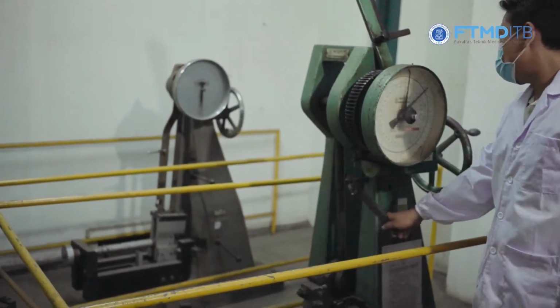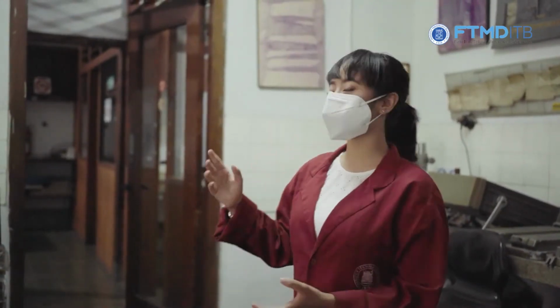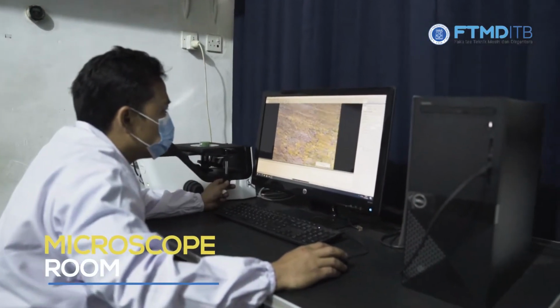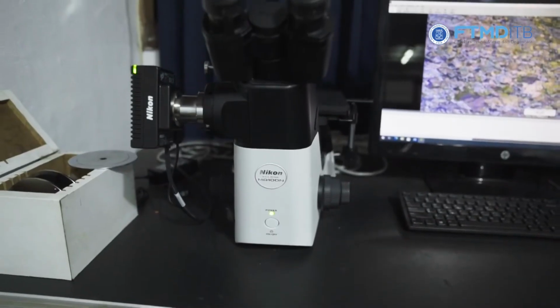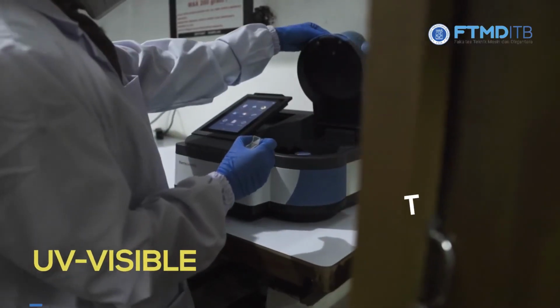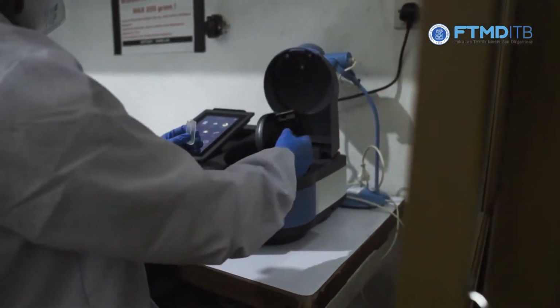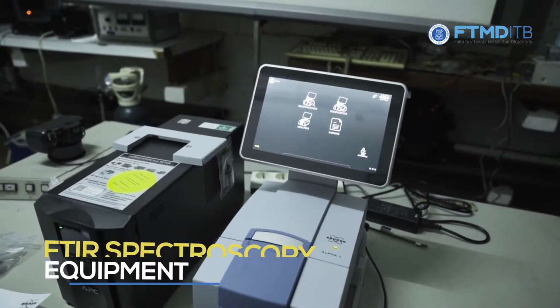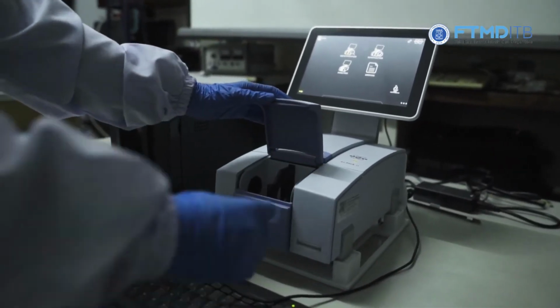Let's move on to the other room. Besides mechanical properties characterization, we have several pieces of equipment for visual, optical, and chemical characterization of materials. Visually, we can see the structure of materials in metallography through microscopes that we have in this room. This is our UV-visible spectroscopy. With this, we can characterize optical properties of materials. We also have Fourier transform infrared spectroscopy, which can be used to determine the functional groups of the sample, mostly for organic materials.